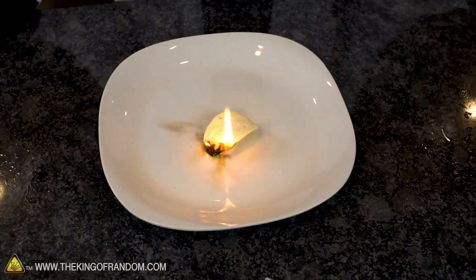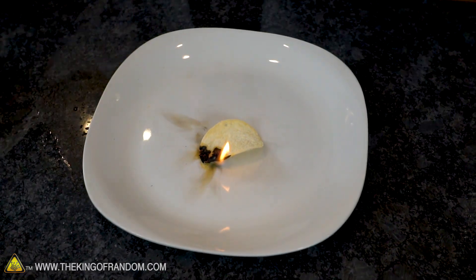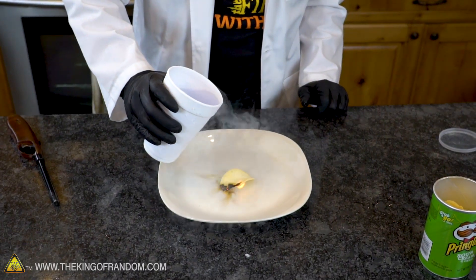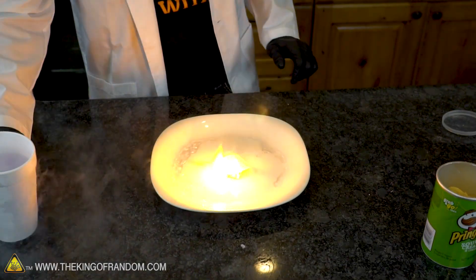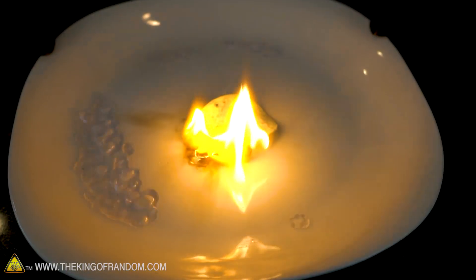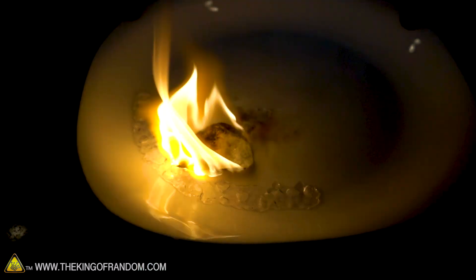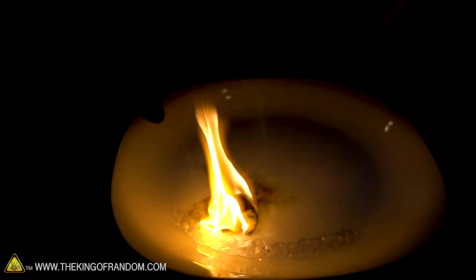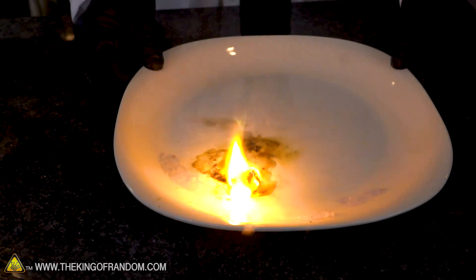It's not nearly as fast as I was expecting. And now look it stopped burning - it was kind of like fizzling and popping and going quite quickly and now it's slowing down. So let's pour a little bit of oxygen on it. Oh yeah, we can get it to reignite - look at that. Slide that chip right toward the oxygen.